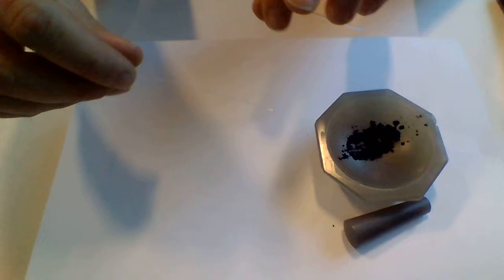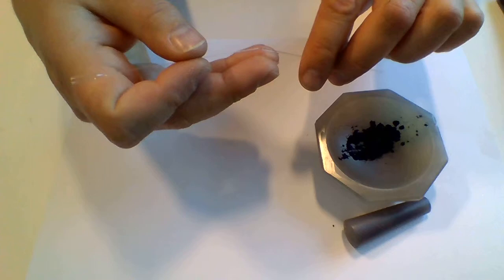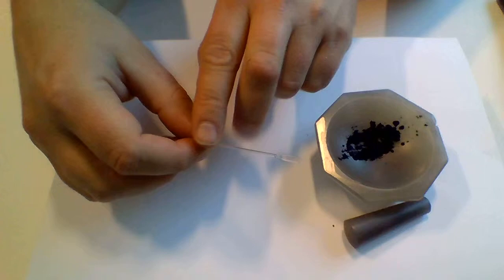This gives some stability to the capillary here. It is extremely fragile as you might guess. The idea is you put your capillary into the melting point tube and then you have better integrity so now you can hold on to it.